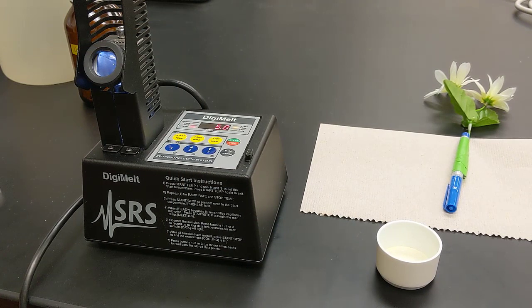Alright, so the last part of this experiment is to determine the melting point range for our final product. I won't force you to watch this, but the expected melting point range is 178 to 181. So after this video, what I'll do is collect the data and then report it back to you.